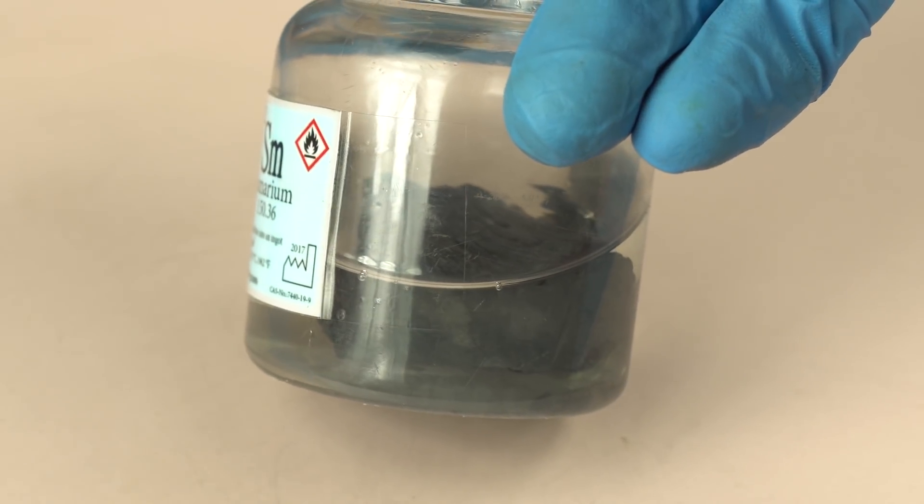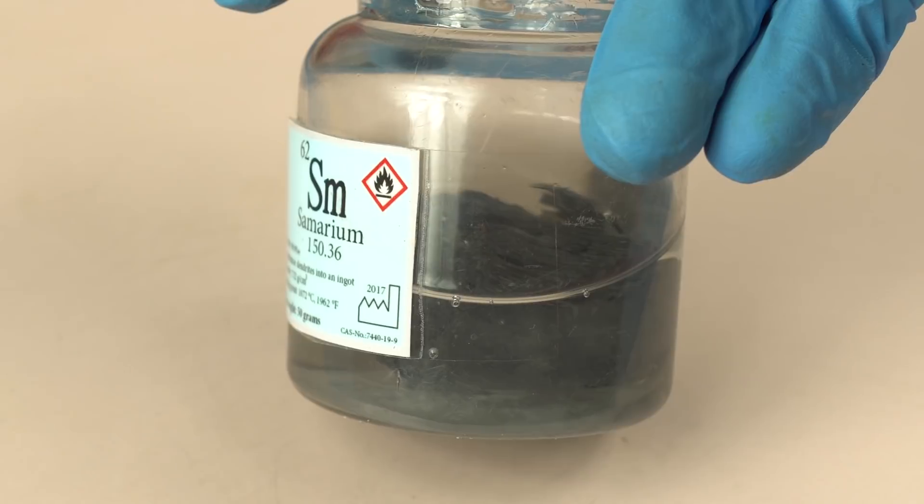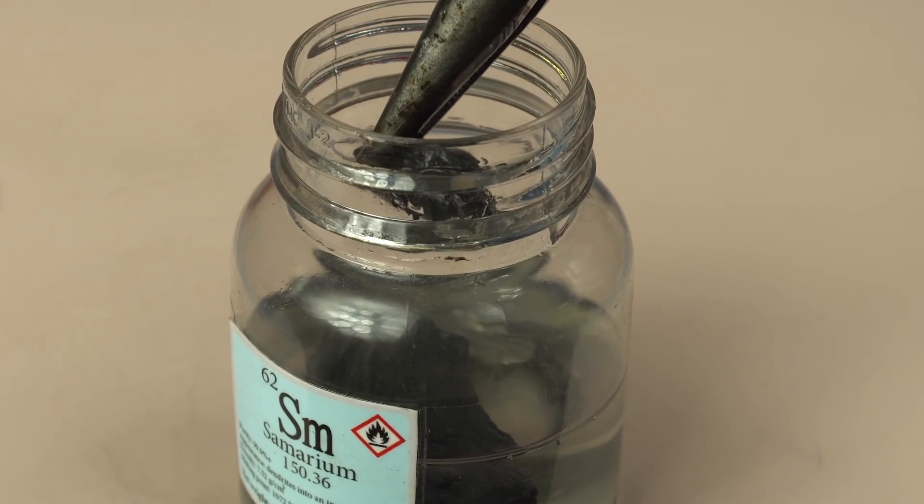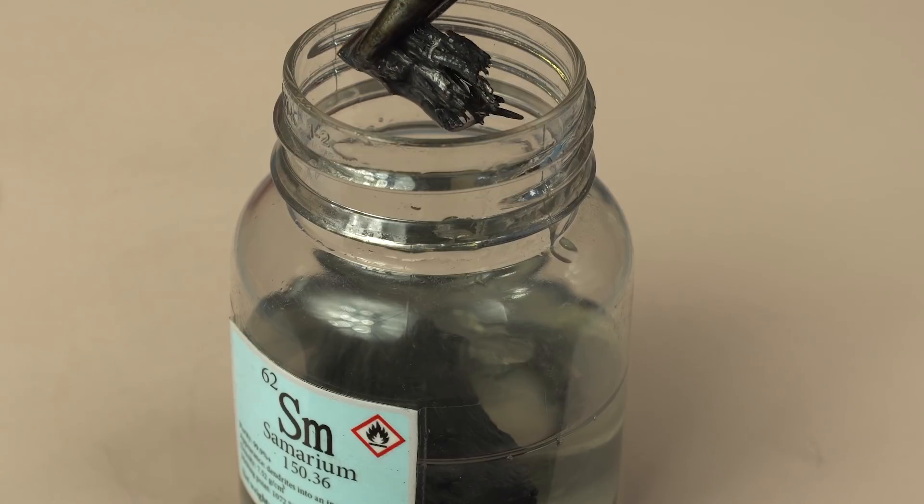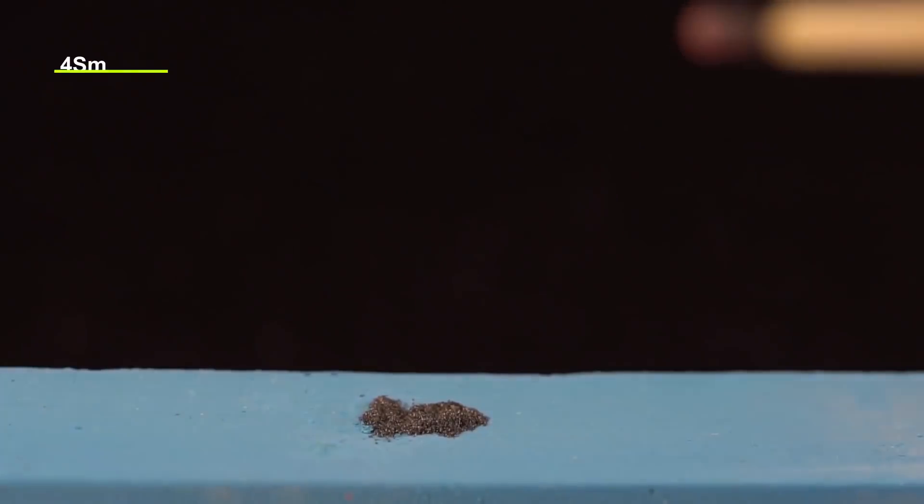I also had some metallic samarium and knowing how active it is, I decided to use it for reaction. For those who have no idea, samarium powder is extremely flammable. Even pretty big shavings of it will ignite from a cigarette or smoldering wood.